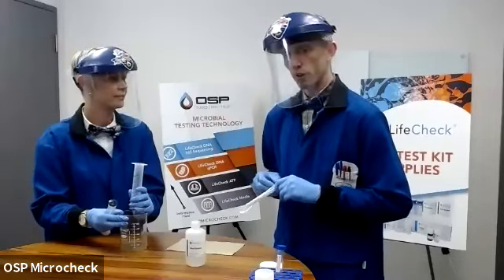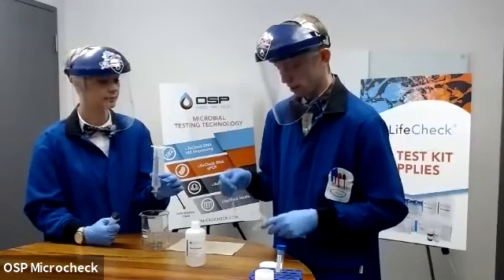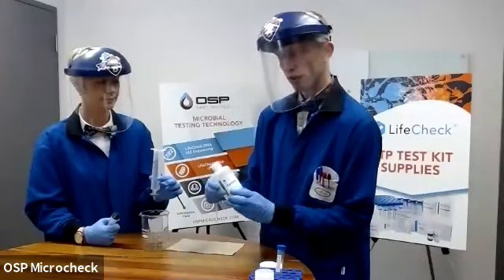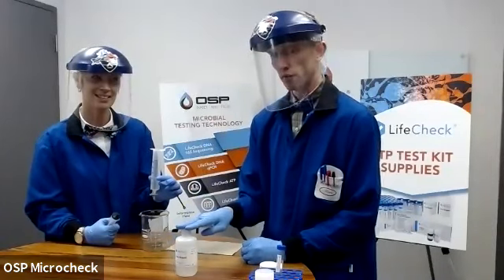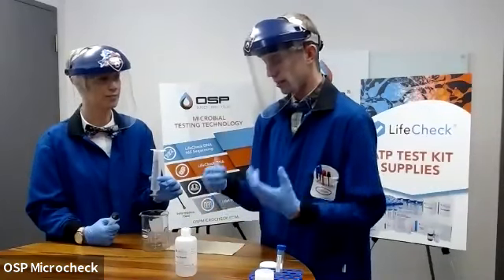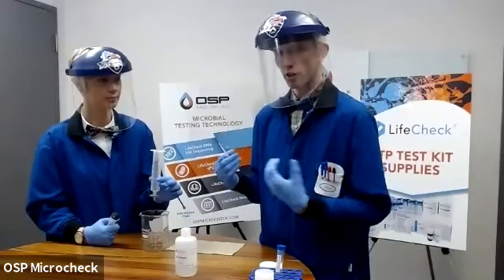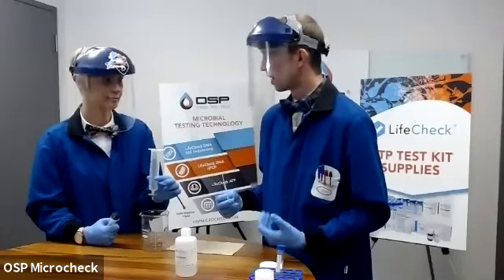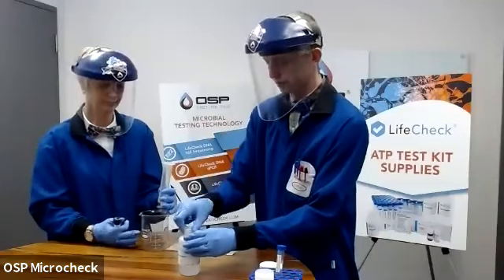All right. So at this point in time, we have our microbial cells collected on that filter membrane. And the next step we're going to conduct is a wash step or a rinse step. The rinse reagent is an additional add-on that you can purchase for our kits. It is an add-on that I highly recommend you use on all sample points. The intention here is that we're going to be providing an excess amount of our rinse reagent and passing it through that filter syringe to free our trapped microbes of any other chemicals or contaminants, residual hydrocarbons, for example, that might become inhibitory to the downstream process of actually measuring the amount of ATP.